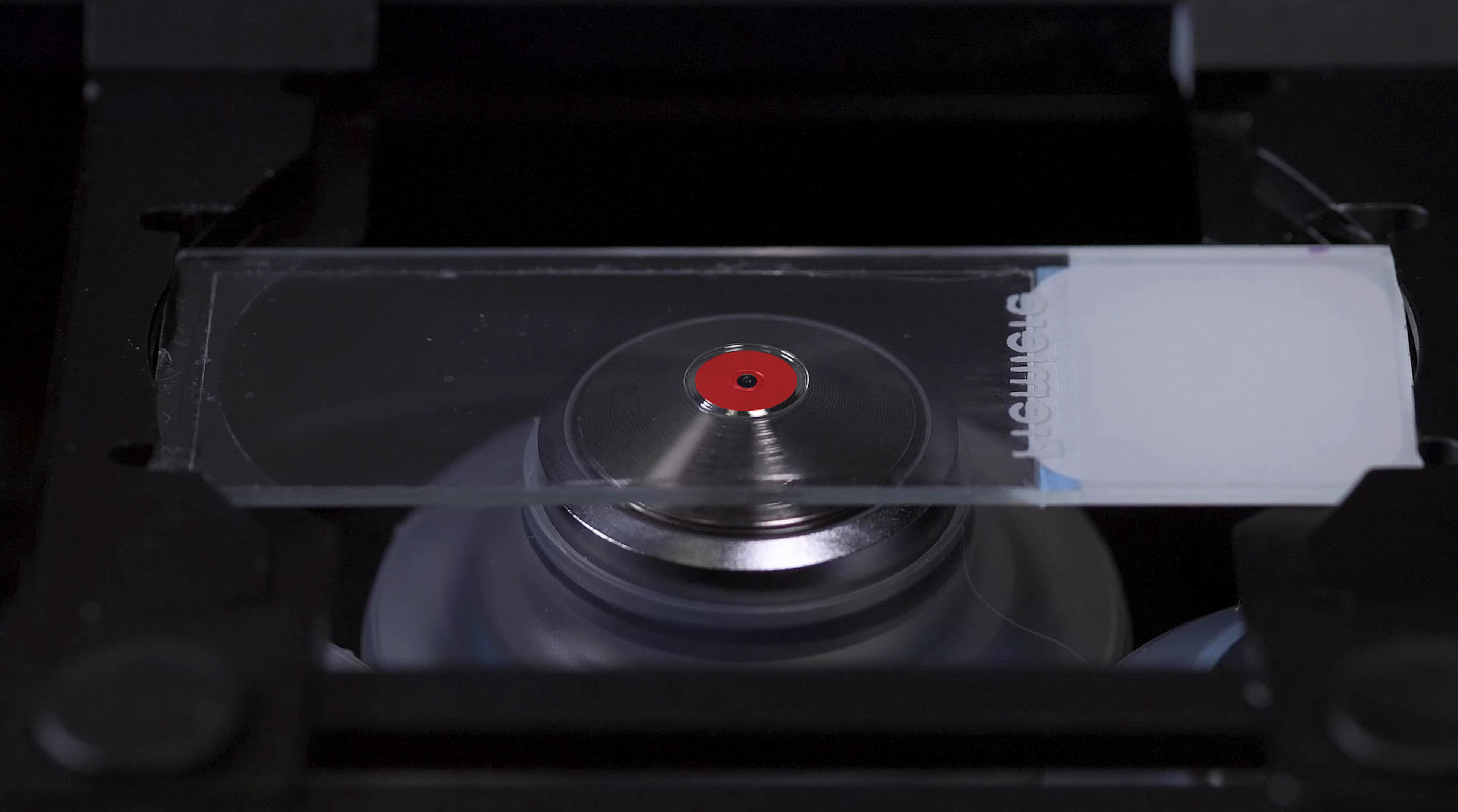If the oil bead is much larger than this well, oil will begin to run down the side of the lens and potentially damage it. If the bead is smaller than the well, but still covers the front lens, this will work, but when you start to move the stage to different positions, you might have trouble with the oil covering enough of the lens. Practice adding just enough oil to fill the outer machined well, but be very careful to not add too much oil.